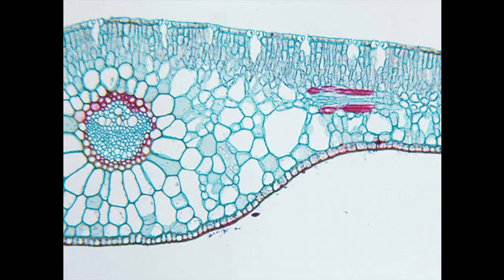Now I've got a few more here just to show you that the arrangement can be a little bit different sometimes. So here we've got an epidermis on both sides. I can actually see on the bottom a little bit of a cuticle here too. So I might be thinking that this might be the top, but actually I've definitely got my palisade on this side, so I'm pretty sure this side here is still the top. Although I see some stomata here, some pores, so it seems a bit odd to have the stomata on the top. So I'm not actually 100% sure which is the top and the bottom on this one.